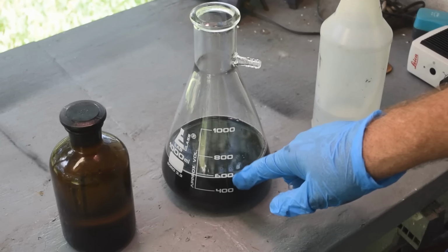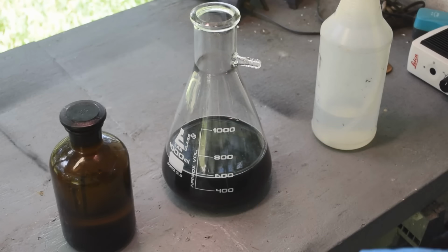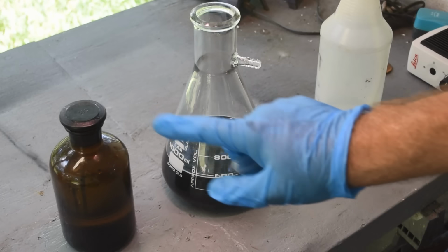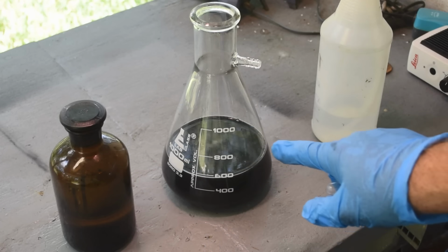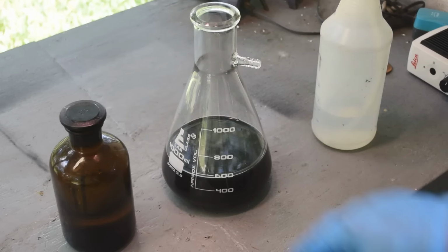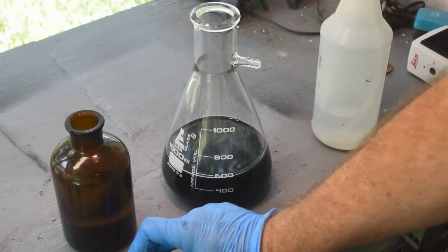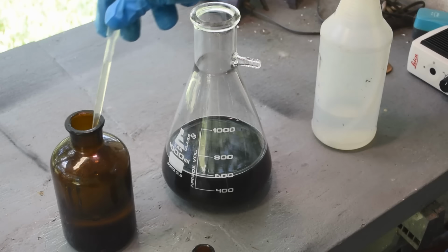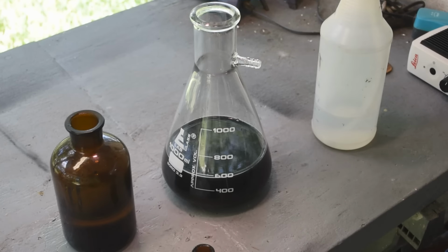So since these particles went right through my filter, they've got to be really, really tiny. So I'm thinking there's probably not that much palladium here. I'll bet if I just put a milliliter or two of nitric acid in here, this will clear up, I'll bet you. We'll see. I can always put more. So I got my homemade nitric acid here. We'll start with, well, that's about 2.5 milliliters. What the heck? Ooh.